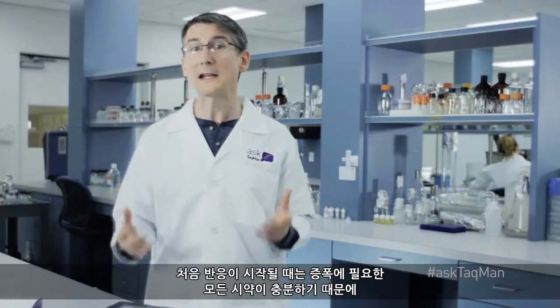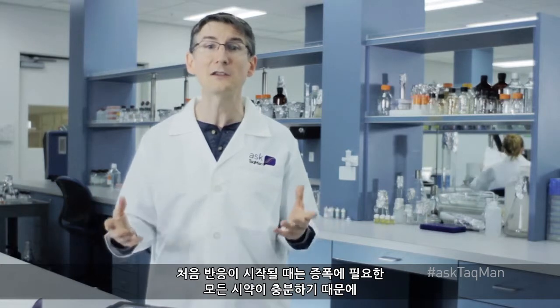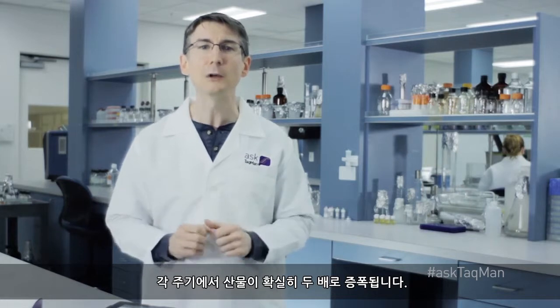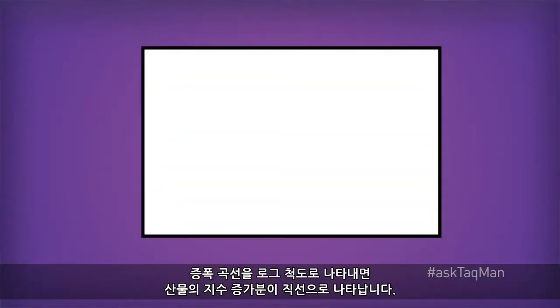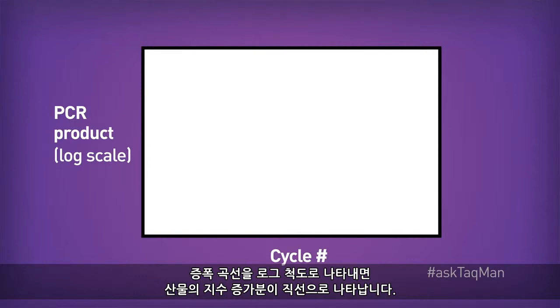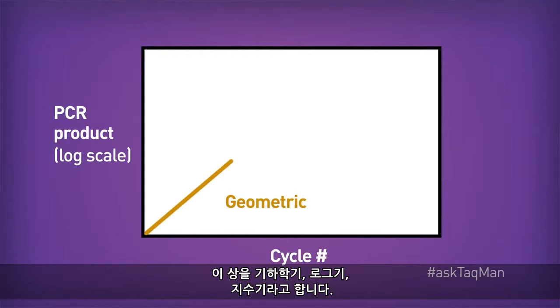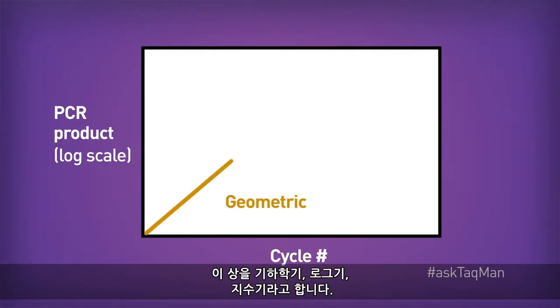When we first start our reactions, there's a molar excess of all the reagents needed for amplification. As a result, we typically get a nice doubling of product with each cycle. In an amplification plot set to log scale, we see that exponential increase as a straight line. This phase is known variously as the geometric, log, or exponential phase.